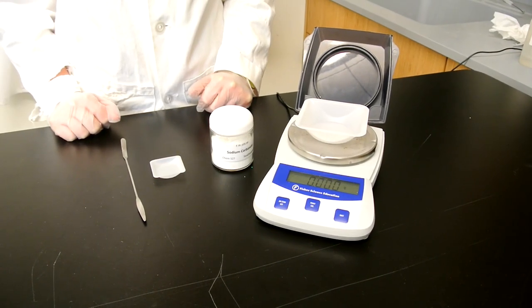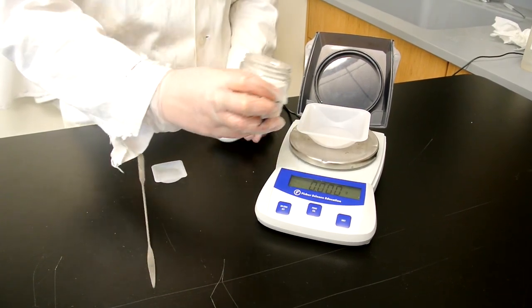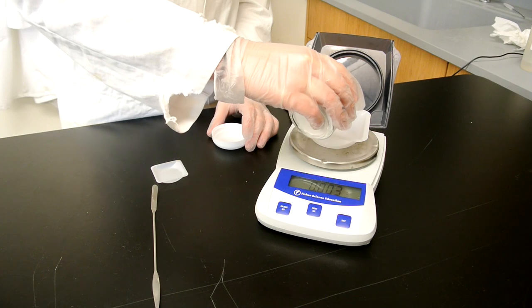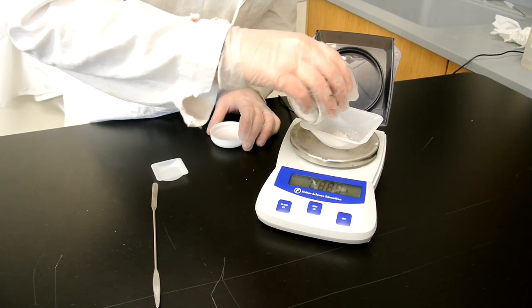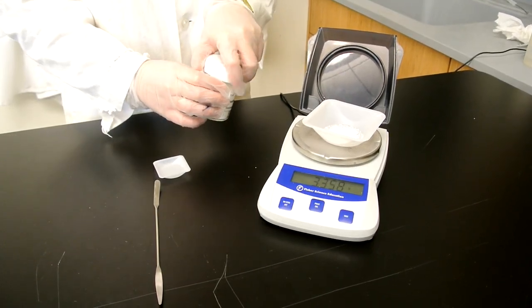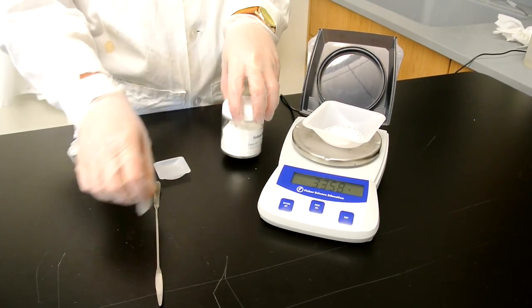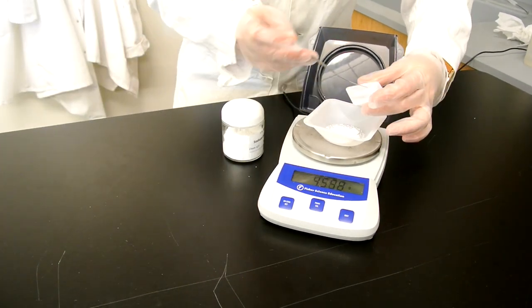As previously stated, we're going to measure out 3 grams of sodium carbonate. Begin by pouring the solid into the weigh boat. When you get close to your desired value, use the spatula. If you go over, take some of the solid and put it into a different weigh boat.